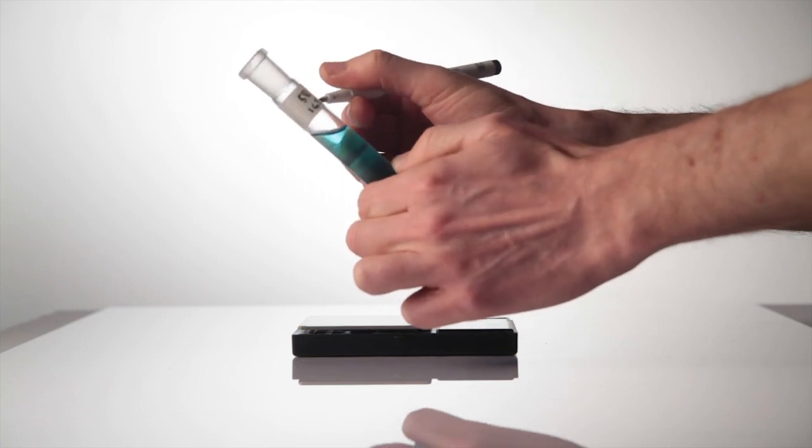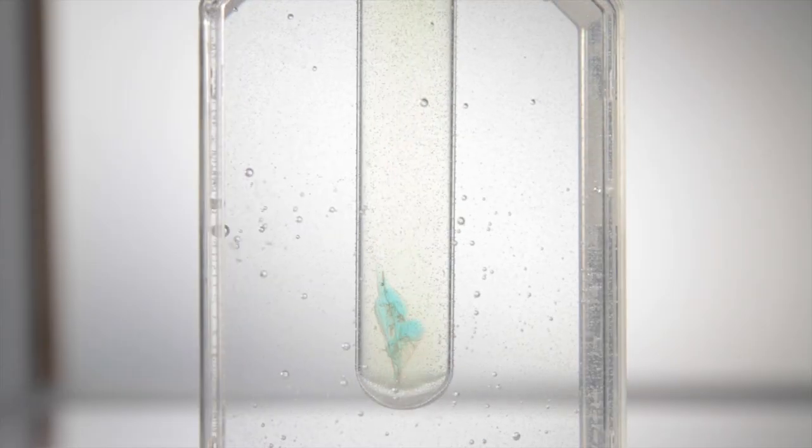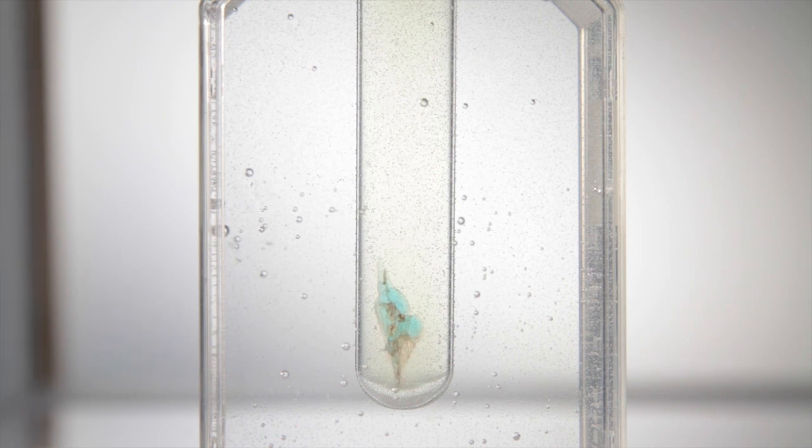Use your recorded masses to check the final density of the solutions that you've made. The copper sulfate solution must be lower in density and it's wise to check your pair of solutions before using in front of a class to make sure that the blue droplet doesn't just immediately sink.